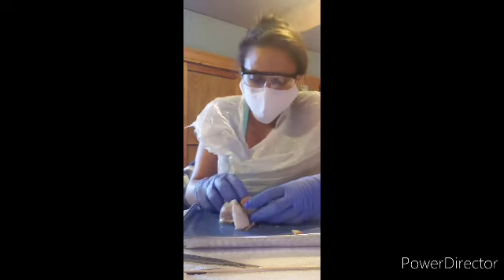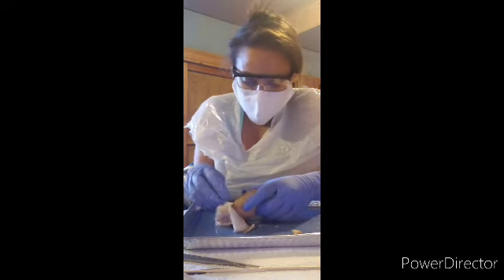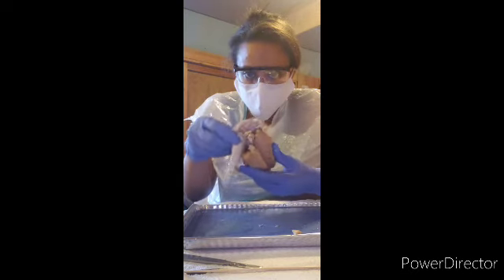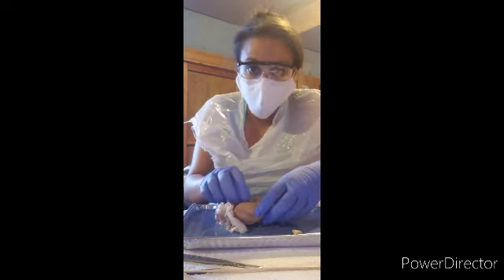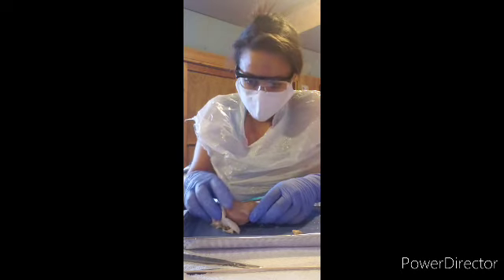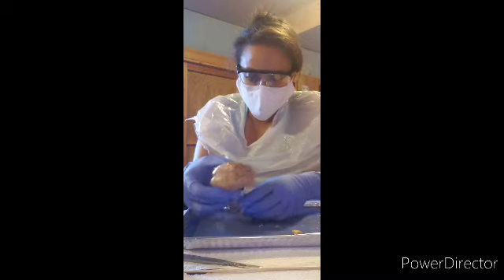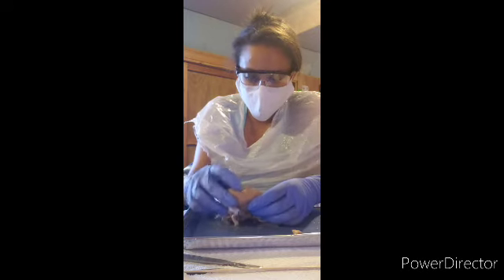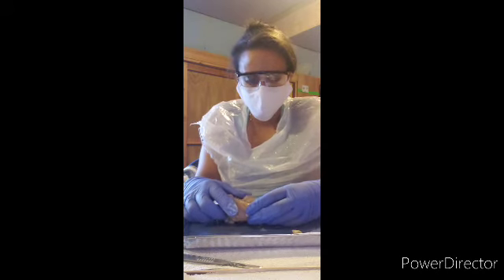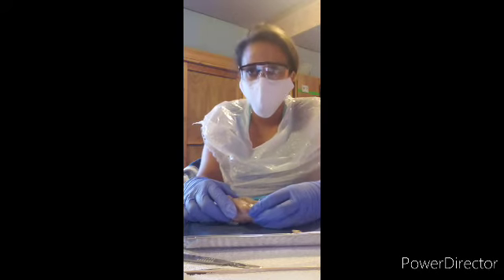Now this, as you can see, the white area connects the brain. Now I did cut this. Now this easily broke apart because of the cutting, but they were stuck together. And since I broke it apart, it's easily separated, which is the colossum.